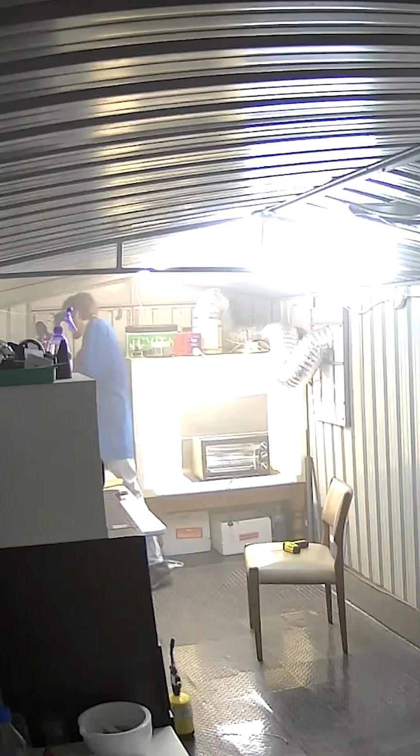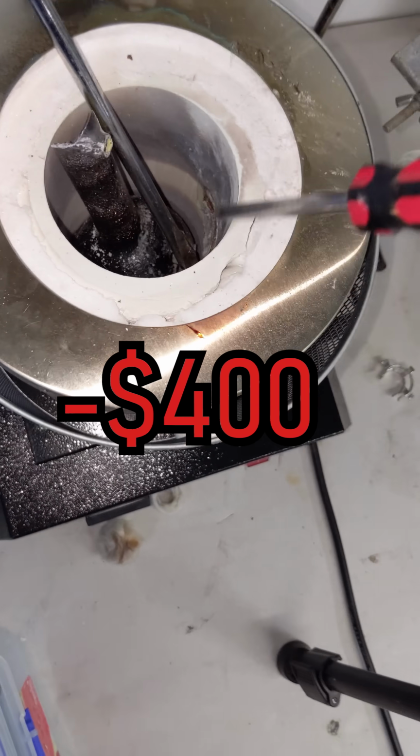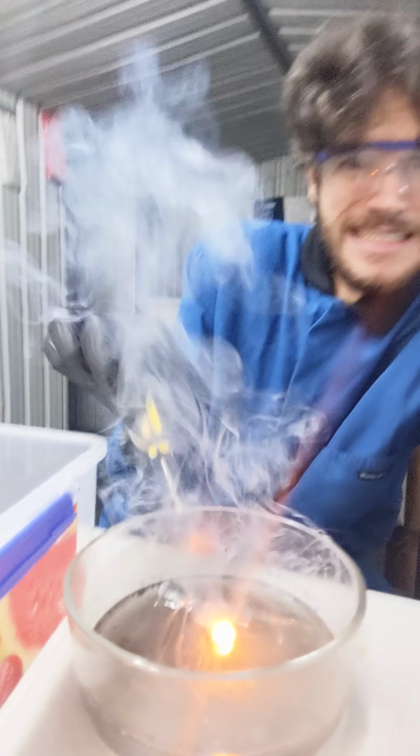The smoke doesn't affect my lungs as it's different from organic smoke and not concentrated enough to cause any harm over a few minutes. After the portal to hell was closed, I was left with a broken piece of glassware and some dirty potassium metal.